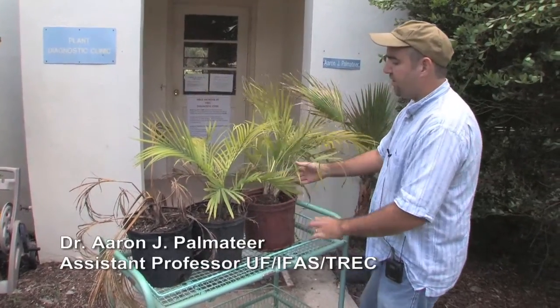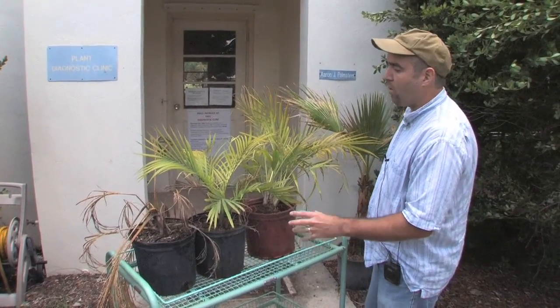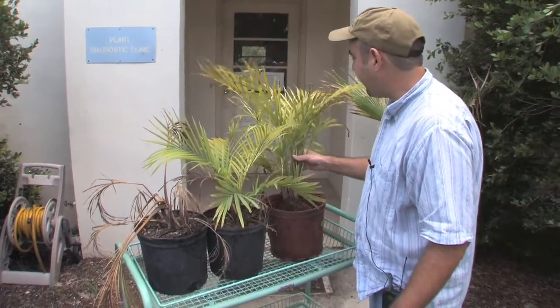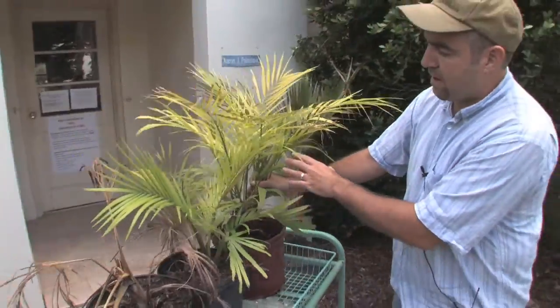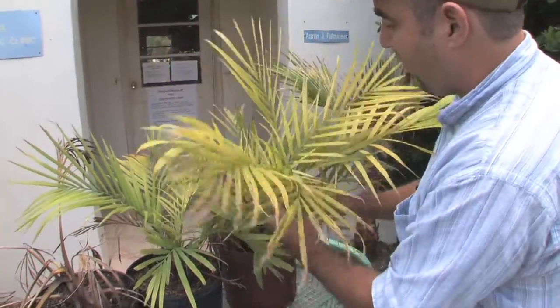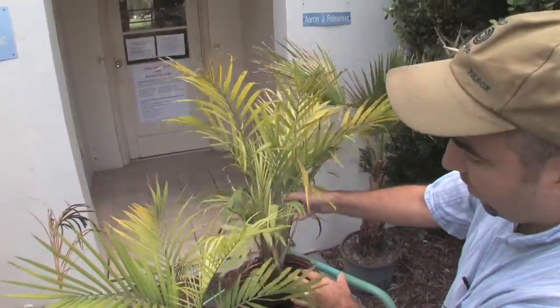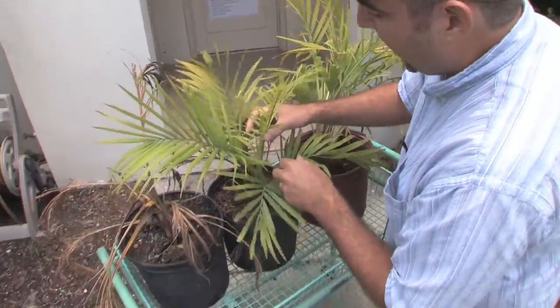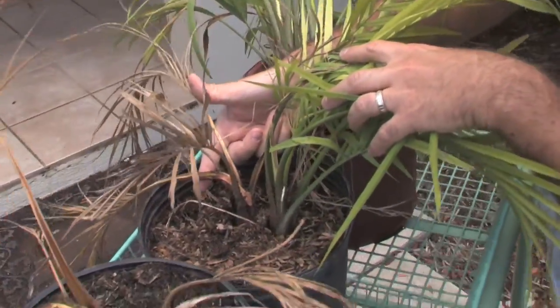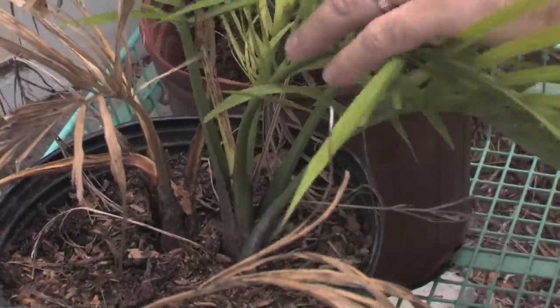Here I am at the diagnostic clinic where we just received a majesty palm sample. It's really important to show that this grower actually brought us three different samples. You can see the symptom range: this one here is probably the best looking — no bud rot — and then the second one in the middle had two plants in the same pot, and this one has pretty much gone completely downhill.